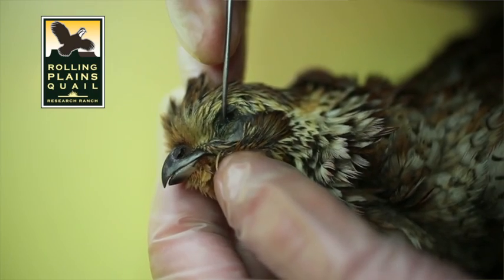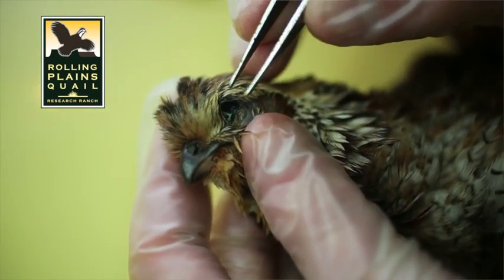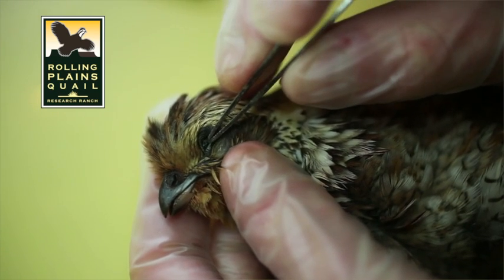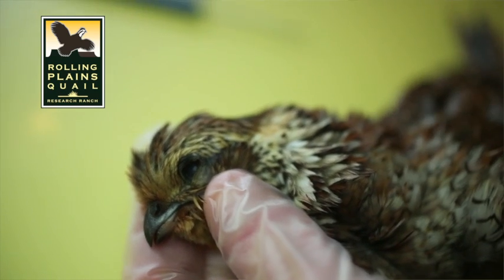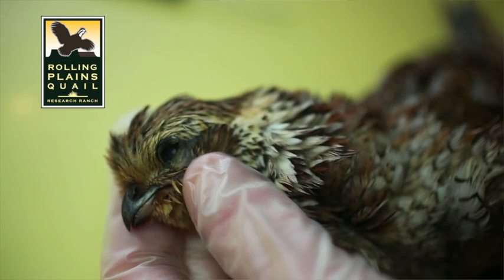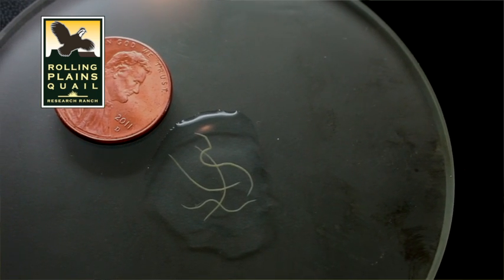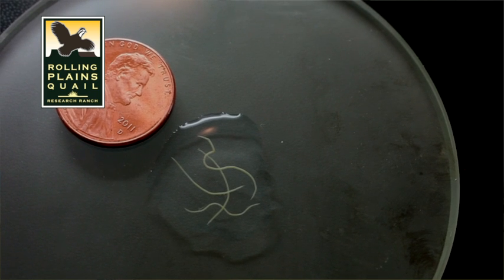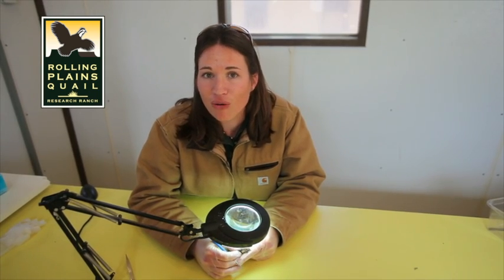When you do find one — like this bird has one — you can scoop it out with the probe. See there, and take a hold of it with your tweezers. There's no need to be concerned about the transference of eye worms from birds to humans, because typically you're only eating the breast meat and eye worms are only found in the eye.